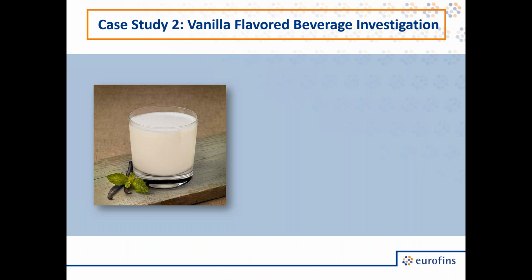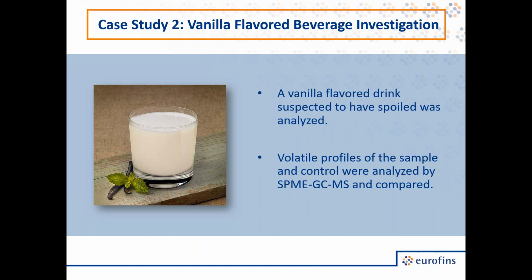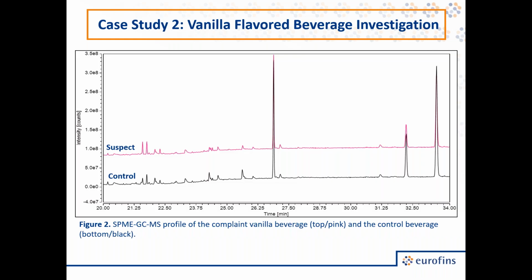So our next case study, where we were looking at a vanilla-flavored beverage. So this was a sort of dairy-based vanilla drink, and it was suspected to have spoiled. So we received samples of this suspected spoiled batch along with samples that were unspoiled. So the first thing you might notice in these profiles is that they are a lot less complex than our chocolate samples. This isn't unexpected since this beverage had a fairly mild vanilla aroma to it, so we would expect a much less complex profile. So once again, on top we have the suspect in pink, and on the bottom in black we have our control.